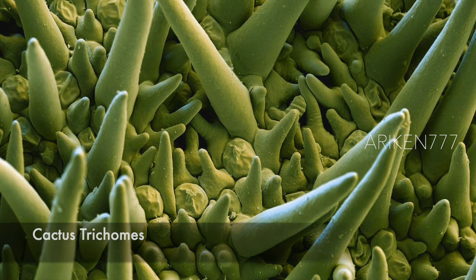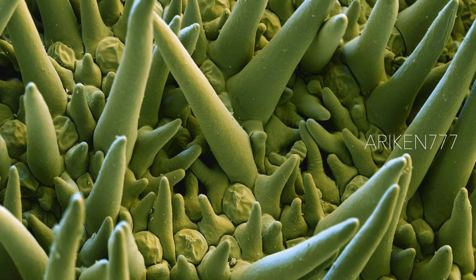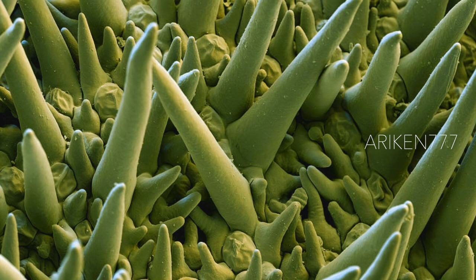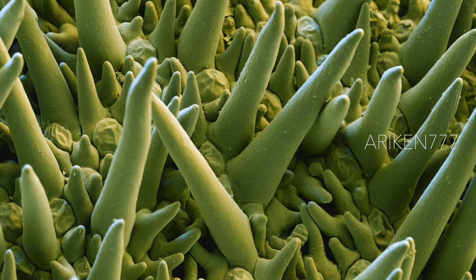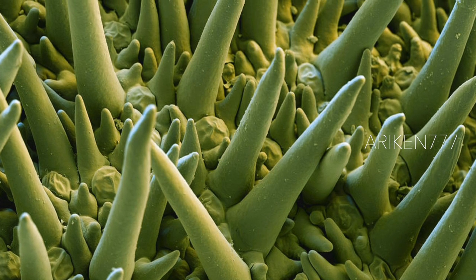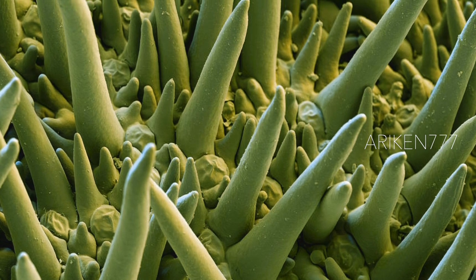The trichomes on a stem of the bunny ears cactus. The long trichomes help to protect the plant from pests. Also seen are smaller projections covering two stomata, which are openings that regulate gas exchange between the plant and the atmosphere. The origin of this cactus is northern Mexico, but it is grown worldwide as an ornamental plant.